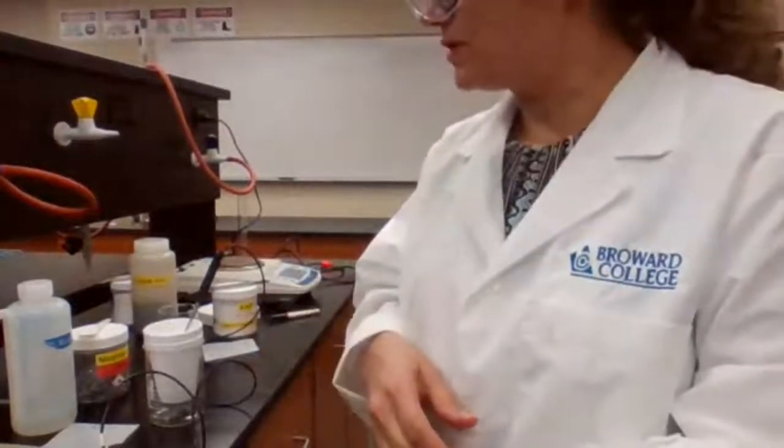I had to do them all together today. But we have to wait until the temperature stabilizes. We can't rush through the experiment to get the best data. But you have your data, you can complete your data sheet and turn it in as an assignment.